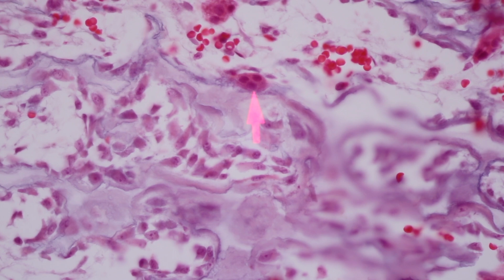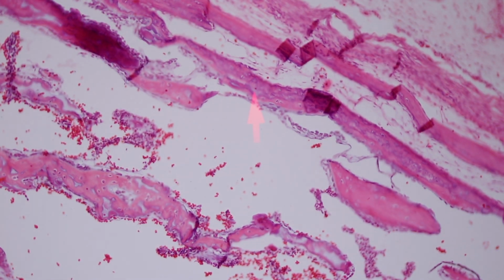And it's through this process of osteoclastic resorption of the mineralized cartilage of the primary spongiosa that we develop, if you will, a hollow medullary cavity that provides the space for the production and development of the hematopoietic marrow. So it's a beautiful example of enchondral ossification producing the medullary cavity.